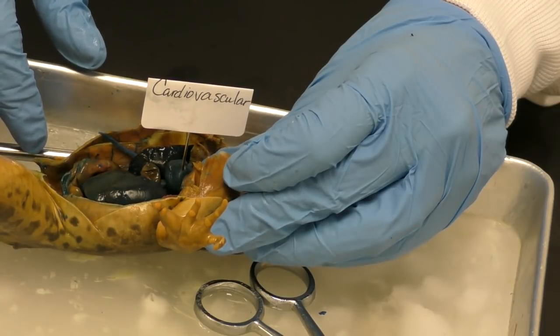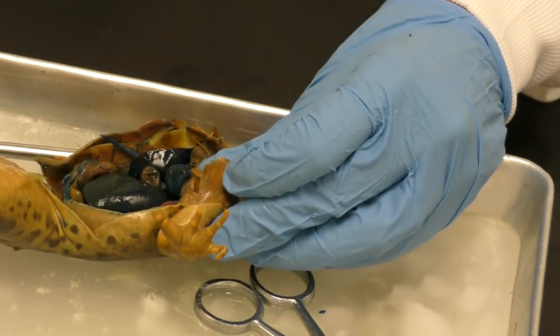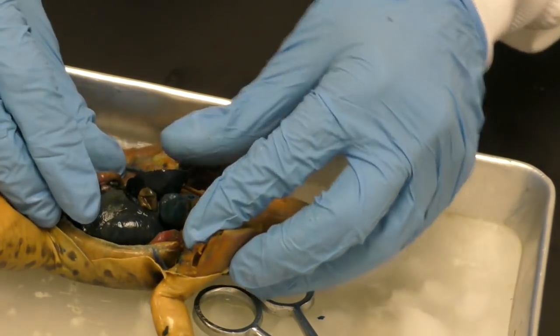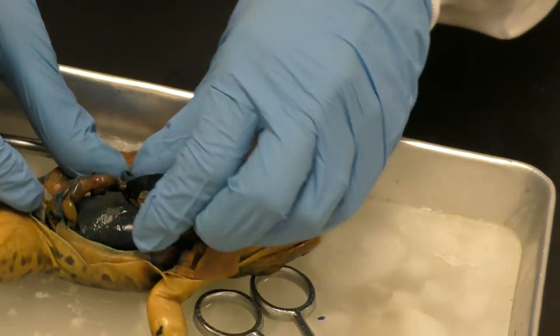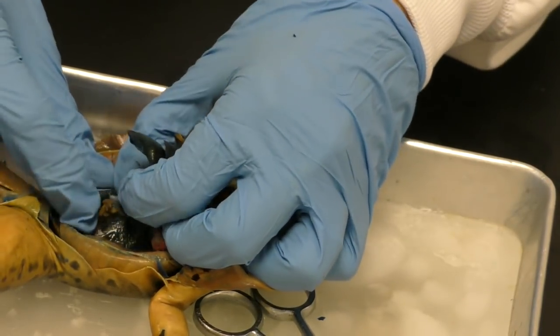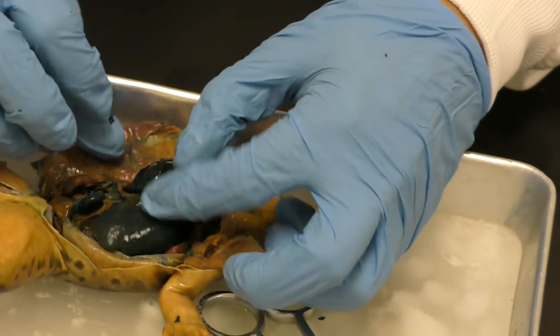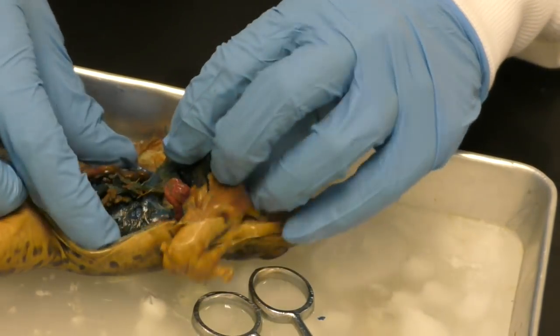So that's it for what I wanted us to do today. If we had more time, which we can, I will continue to video so that maybe you could watch the rest at home if you'd like, is to start to explore this frog a little bit more. Okay. So here's the gallbladder, which is kind of fun to look at.